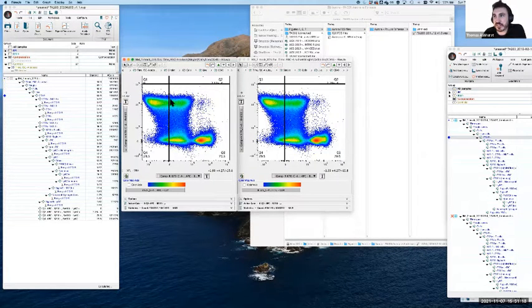you can actually see a bit of evidence here. This is slightly shifted over to the left. There are more cells on the left of that line than there are on the right. So that gives us a little bit of a clue that things have been pushed a little bit too far over in this case, which is good to be aware of.